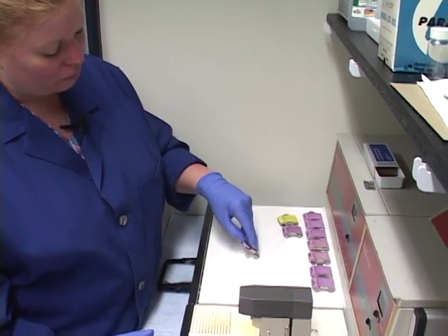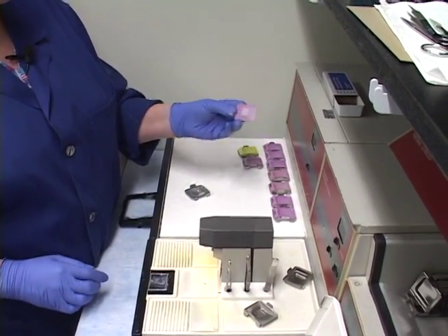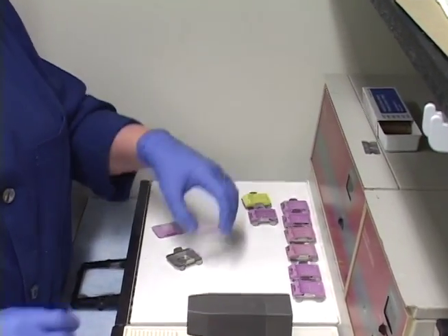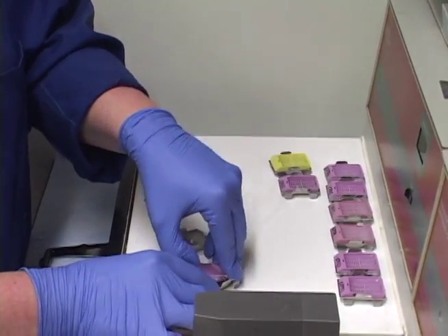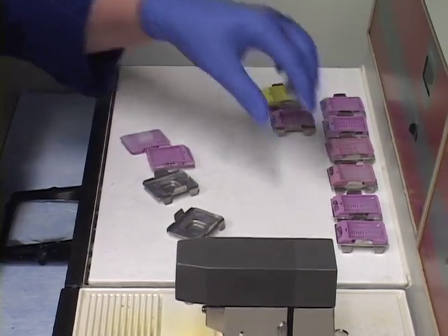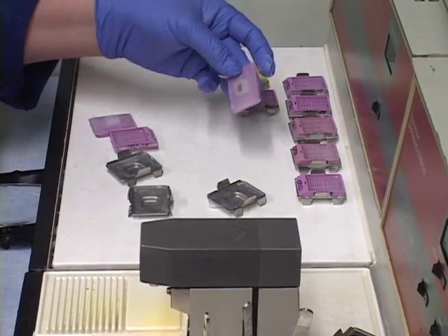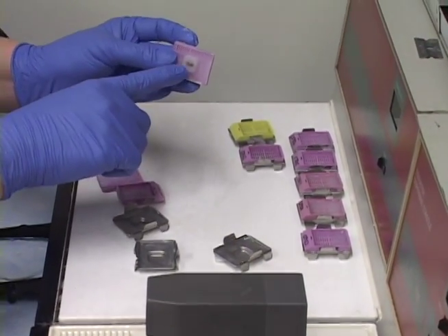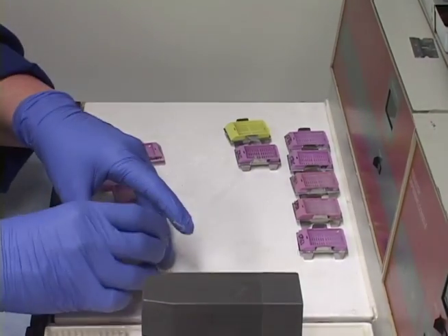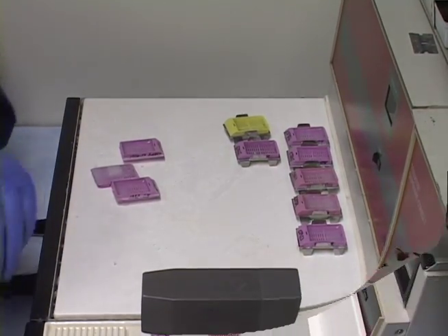The block should come out really nicely with just a little pull. Let me show you — it comes right out. Now let me do one that's not evenly embedded so you have an idea of what that looks like, and then I'll re-embed it later.